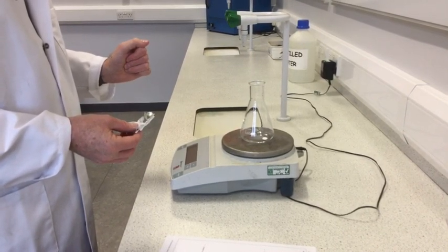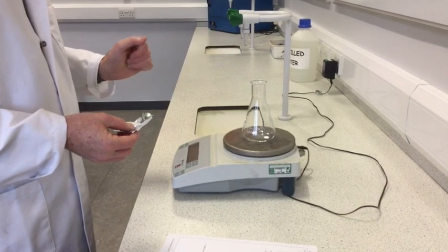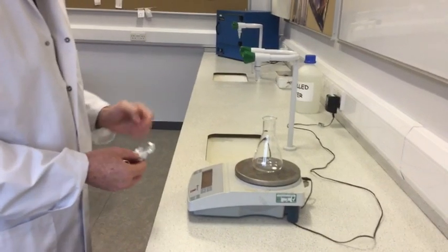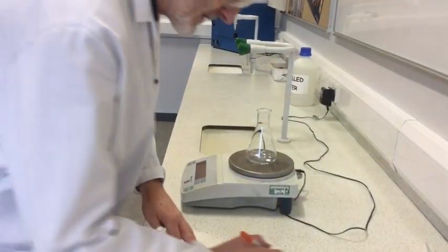So, two or three tablets. I think I'll just stick with, you want to stick with a whole number of tablets. So, I'll go with two tablets, at 1.21 grams.